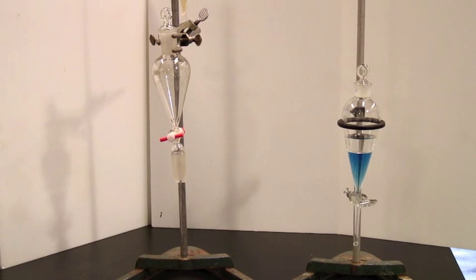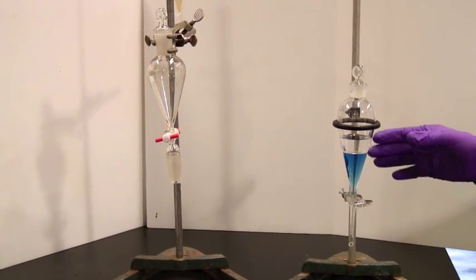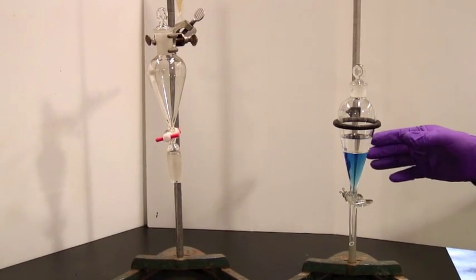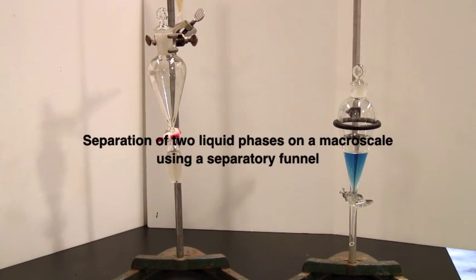Those solvents form two phases, as you see here. This will help you to separate the components of the mixture. This video talks about two-phase separation and washing liquids using a macroscale separatory funnel.